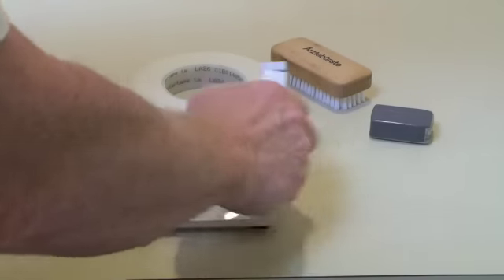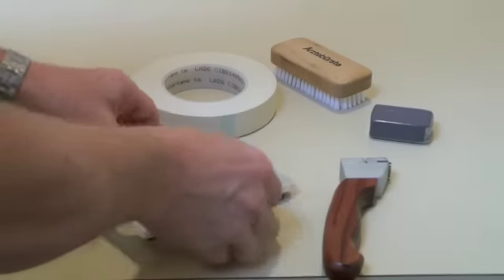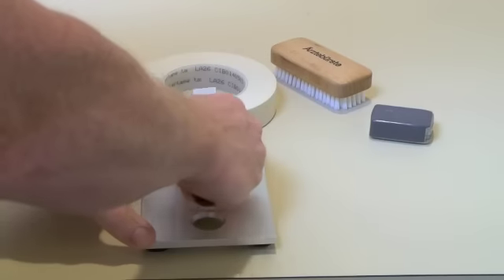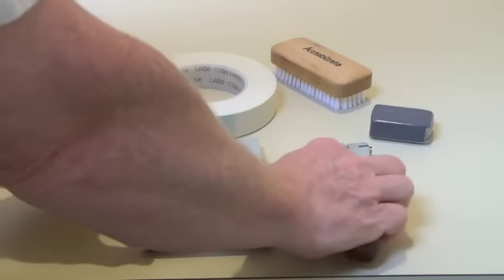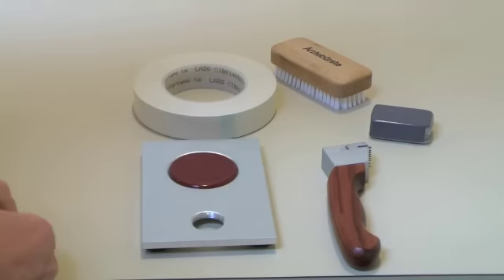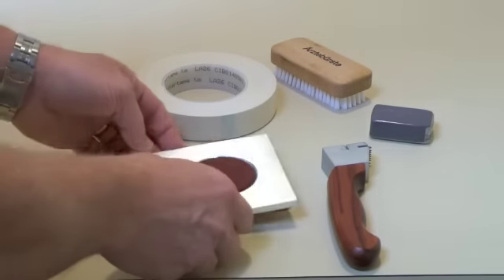And now I have a much larger surface where I can hold the plate, draw my cutter across, rotate it 90 degrees, and draw the cutter again, without danger of cutting my fingers or slicing up the tabletop.